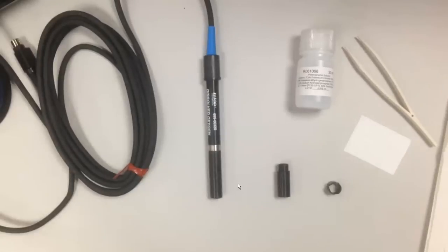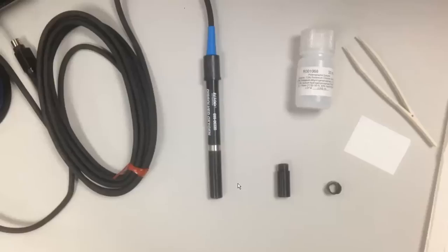In preparing to collect data, you'll need to have the proper burn-in time for the probe head to remove any residual dissolved oxygen within the polarographic solution.